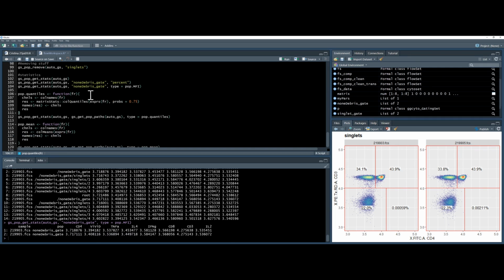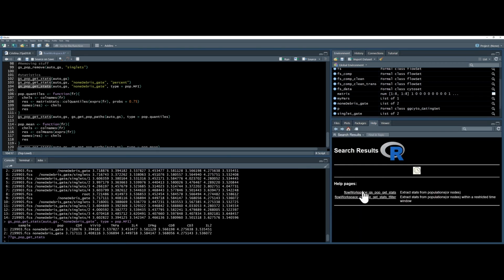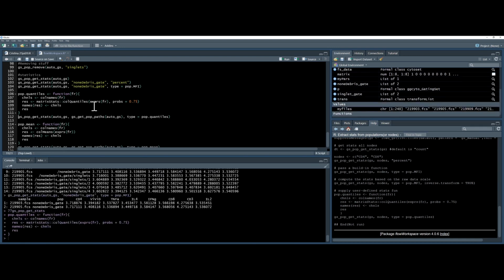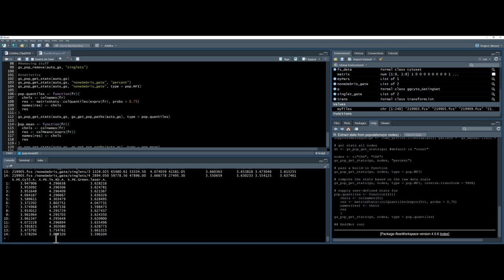You can add functions on this type. You can apply a function. So this is the example from the help file. The help file is, as ever, 2 question marks and the command. And at the bottom, we can see this example of using the quartile. So you produce a new function. If you want to learn about functions, you should do a general R course. And I can apply this new function here. And this will create a new statistics output with my new function.